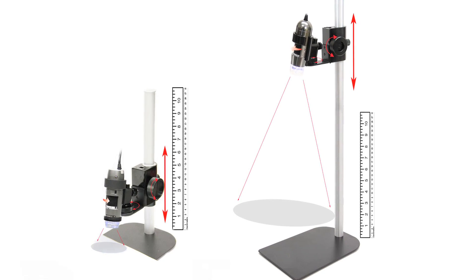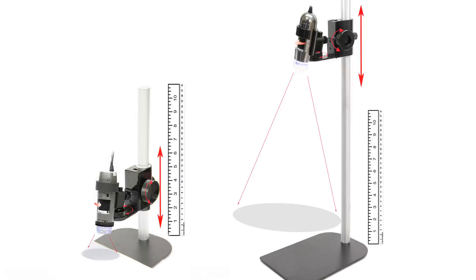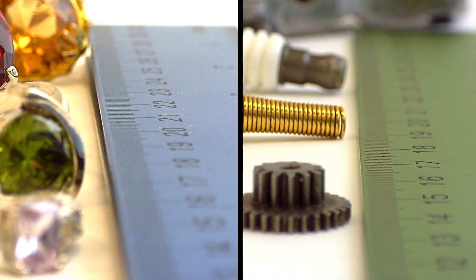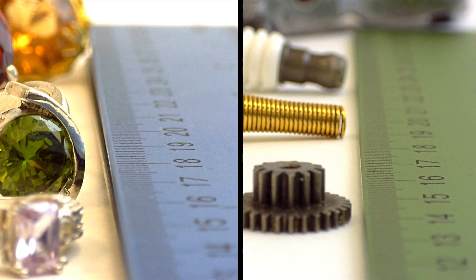At higher magnifications, the focal plane and the amount of depth is much smaller, which makes adjustments in height or magnification have a much more drastic effect.